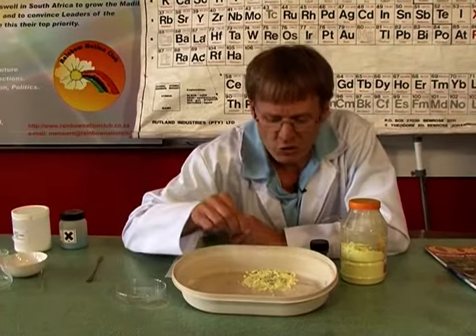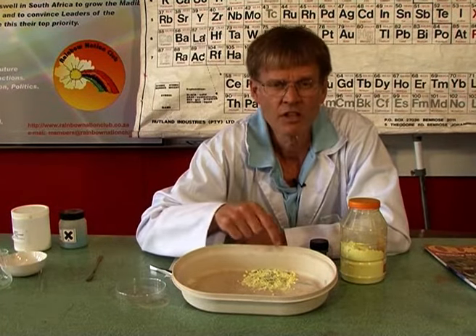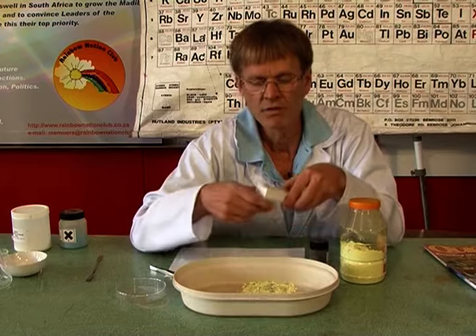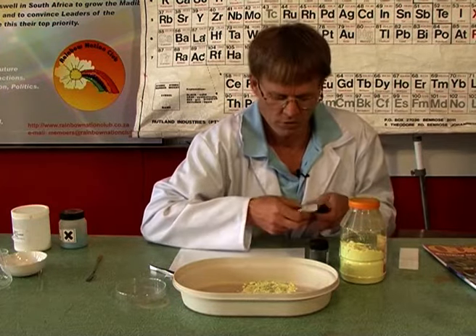Well, we can't go and sort it like we could previously. So what about the sulfur and the iron is different? What are their physical properties that are different? And hid underneath here, I have a magnet. Well, iron is magnetic and sulfur is not.